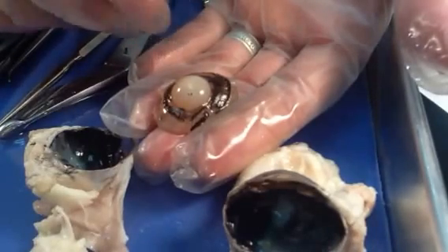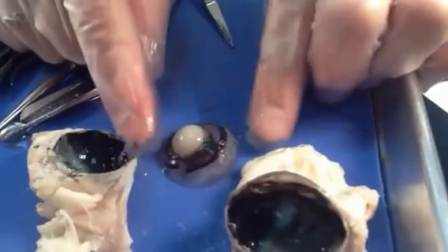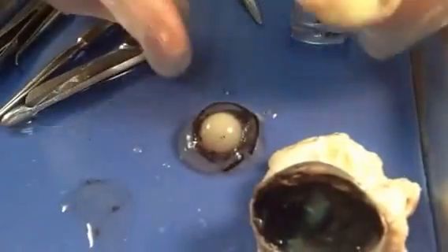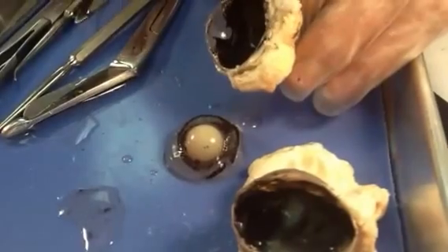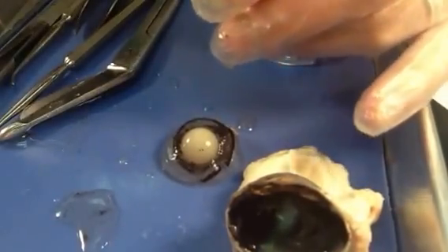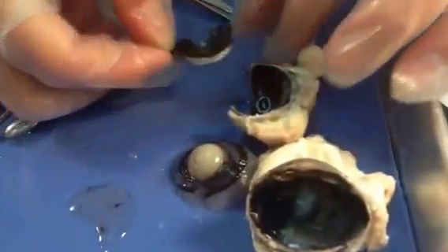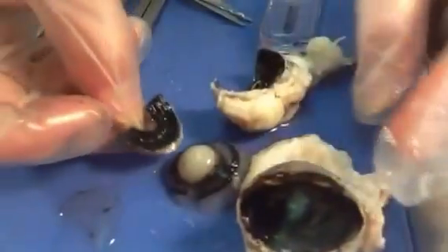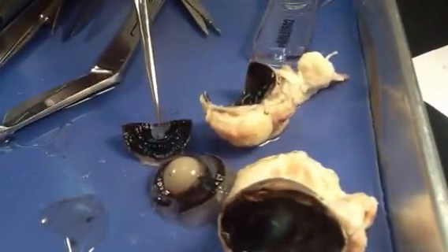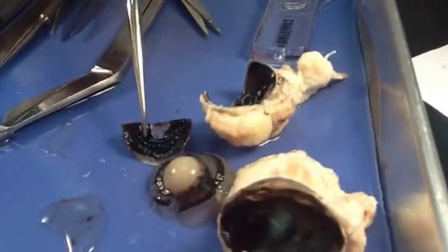This lens would be clear in a normal, healthy eye. We'll take a closer look at it in a bit. You'll notice this pattern on the front that has little lines radiating out from the center — that's an imprint with pigment from the inside of the eye, and it comes from the shape of the muscles that are part of the iris. We're going to cut that out and take a look. We're going to see two types of muscles surrounding the iris around the opening in the middle, which is called the pupil. Around the middle part of the pupil are circular muscles that go all the way around the opening.